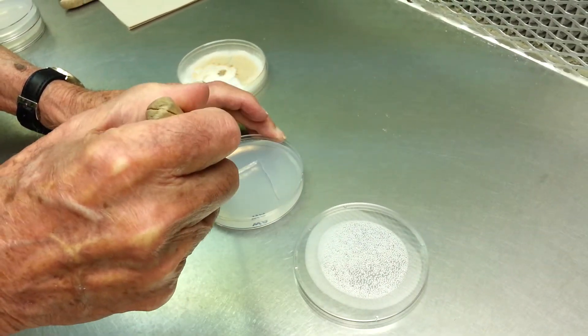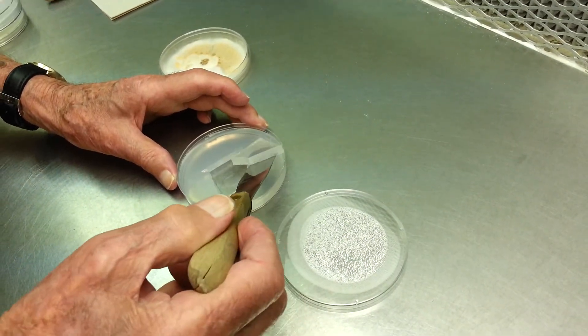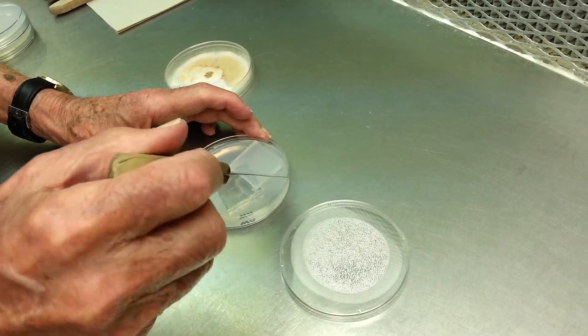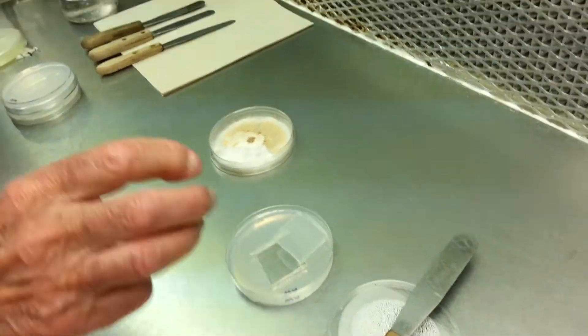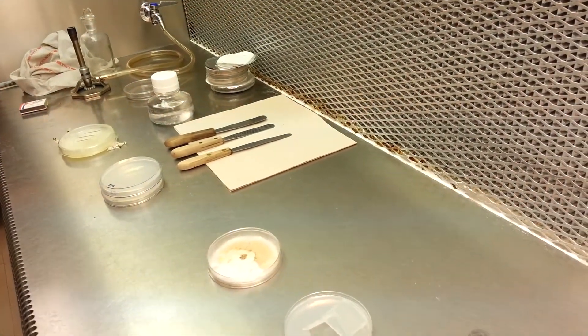A fairly large block, and we put that aside. Okay. And then, we've got to transfer it.